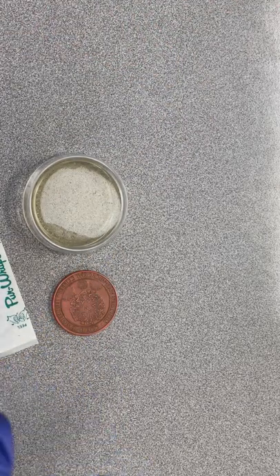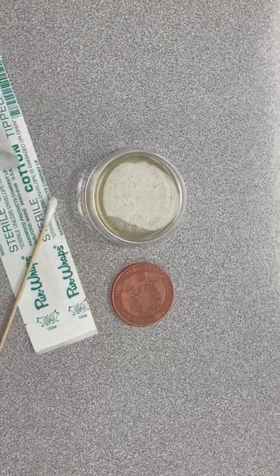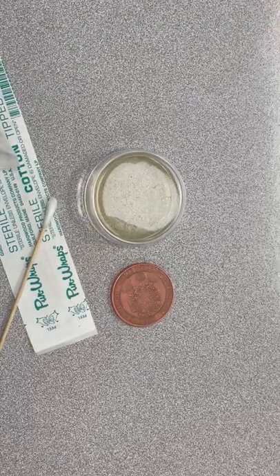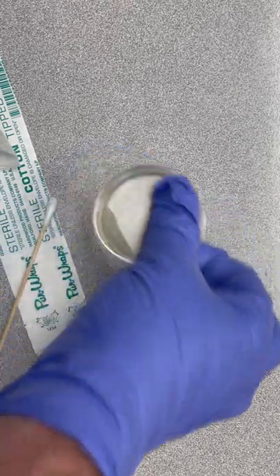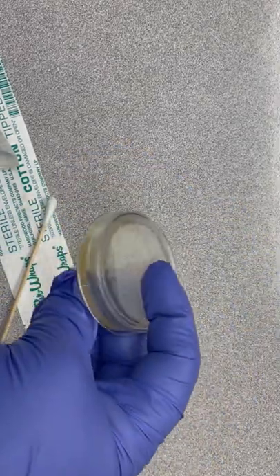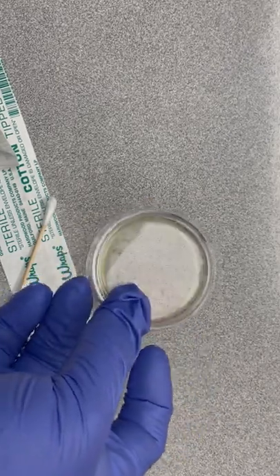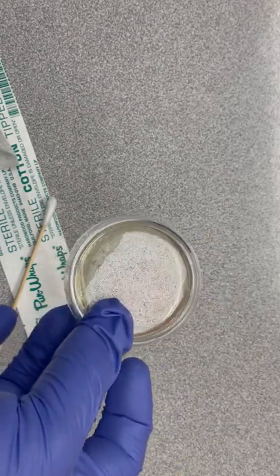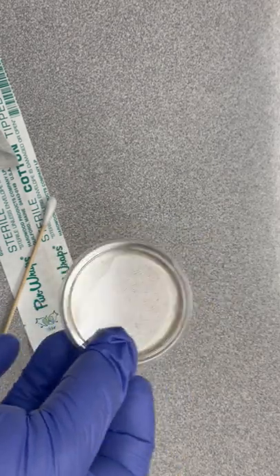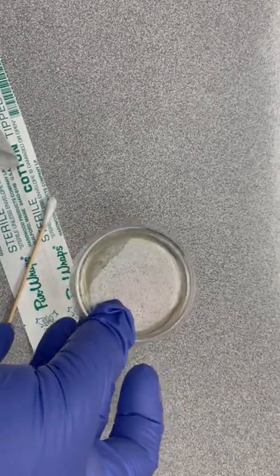Normally what would happen is a science teacher will put this in an incubator to heat it up and speed up bacterial growth. We're not going to do that because I don't have an incubator — I'm a social studies teacher. I've already talked to the science department about this. We're gonna set this out; you can see there's moisture inside, and it is a Friday, so this is going to sit all weekend. I'm gonna put it on my shelf.